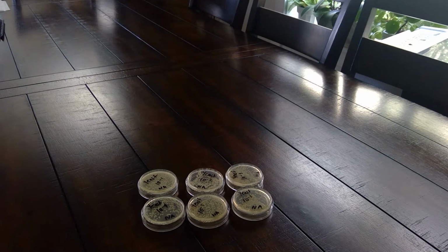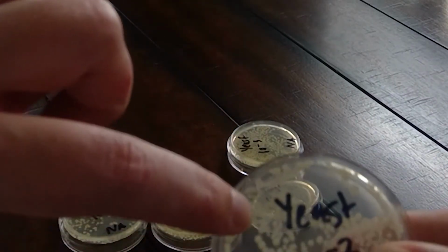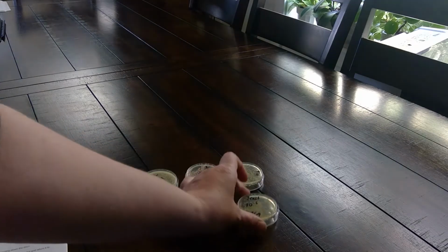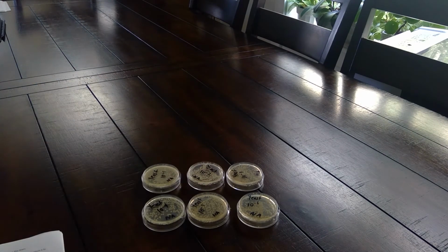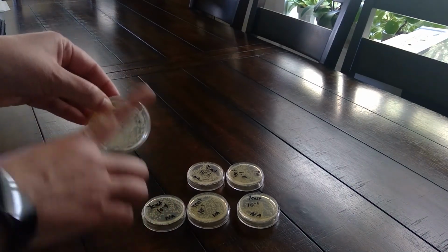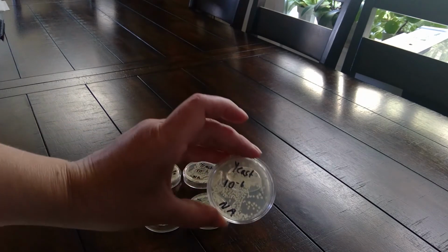So after you get results, then you can start doing part 3, which is the plate counts. And so you should see a trend more like that. But then also I wanted to point out, see how there are areas where there isn't anything growing. You might see that because it's really hard to get all the liquid evenly dispersed over the plate. Just do the best you can to evenly get a coating on the surface of the agar. The best way that I saw was to slowly tilt it and let it go over the agar, but it looks like I must have missed a little bit there, maybe on this one too.